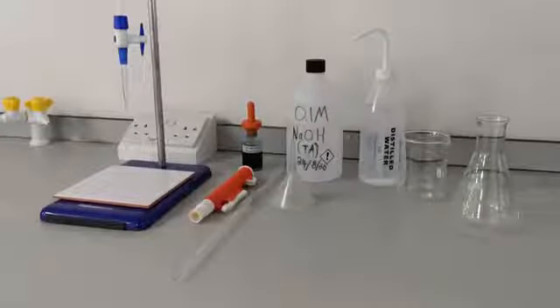In this video, we'll look at how to measure the titratable acidity of your wine or juice.